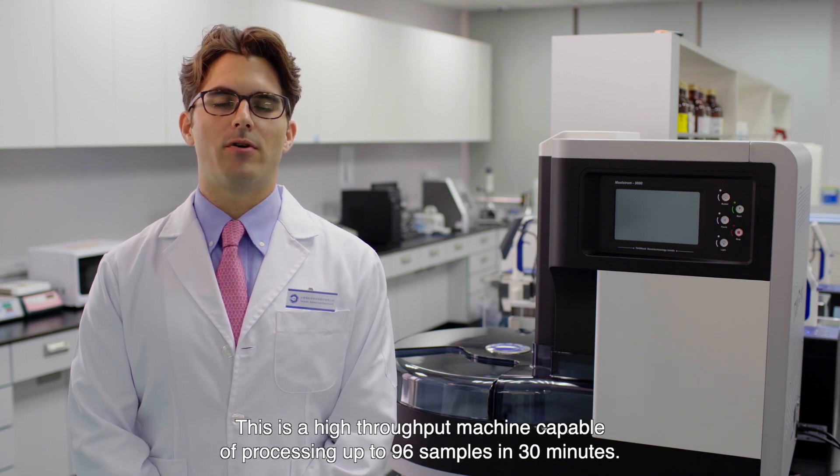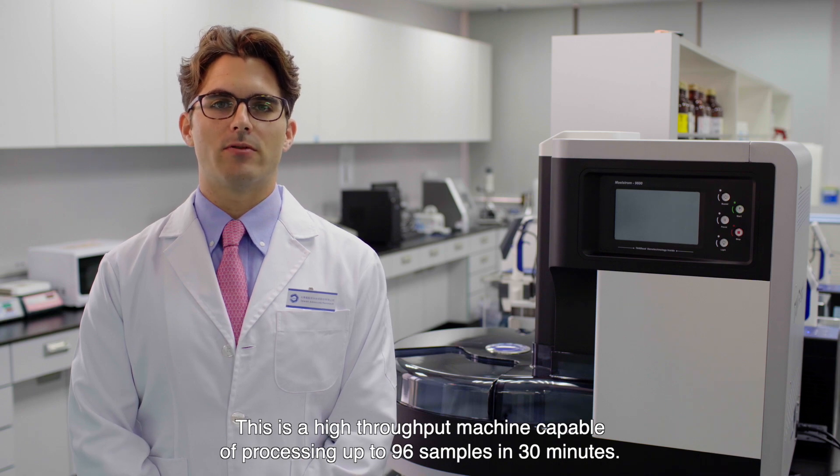This is a high throughput machine capable of processing up to 96 samples in 30 minutes.